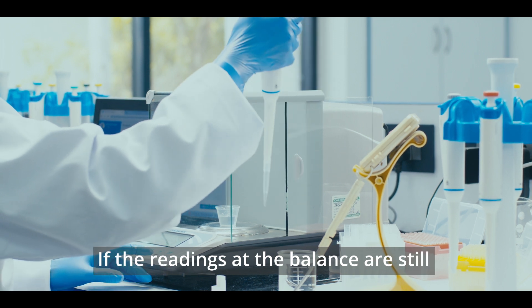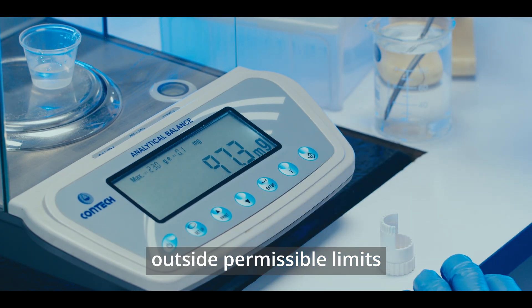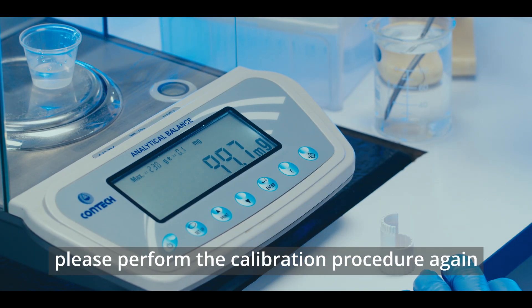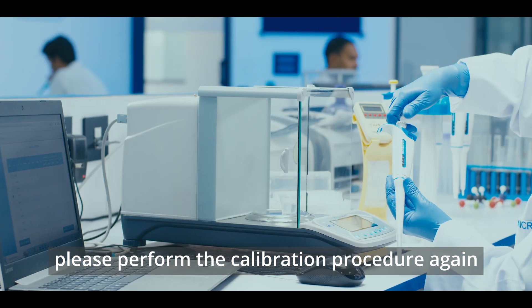If the readings at the balance are still outside permissible limits, please perform the calibration procedure again.